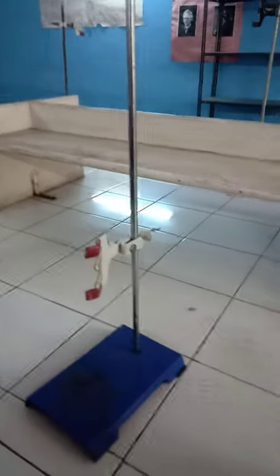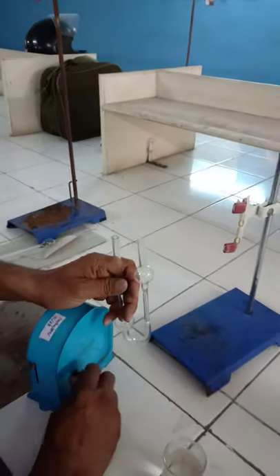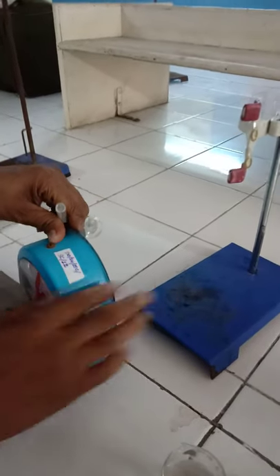Bulb B consists of a capillary tube and bulb A consists of a normal tube. Our aim is to calculate the viscosity of the given liquid by using the Ostwald viscometer. To calculate the viscosity of the given liquid, first we should calculate the viscosity of water.